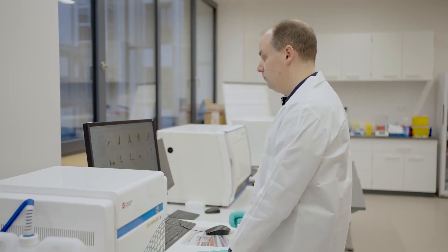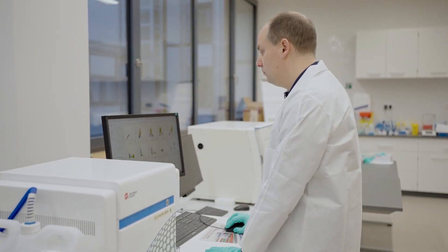My experience with the CytoFlex Mosaic has been incredibly smooth so far. It's been very easy to set up and use. Having tested the instrument in both conventional and spectral mode, I can say that the startup of the instrument is exactly the same for a regular CytoFlex as it is for a CytoFlex with the Mosaic module attached. I found the software very easy to learn, and I was able to start my first experiments within a few hours. In no time, I was able to separate and detect all the markers I needed with confidence.